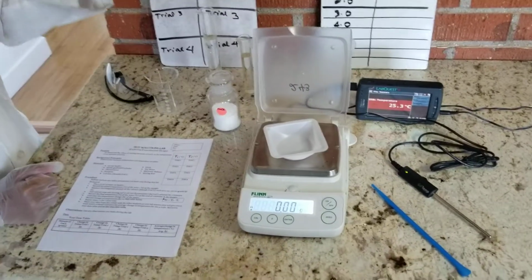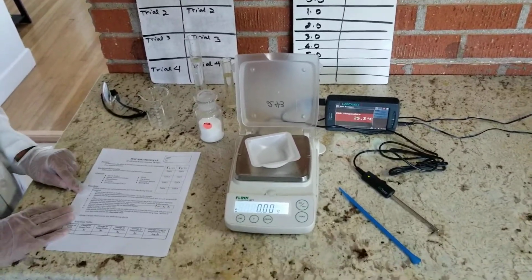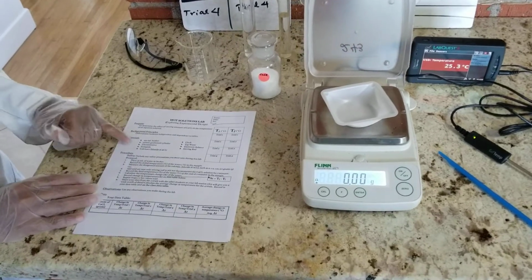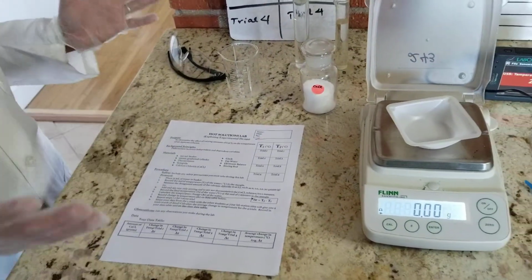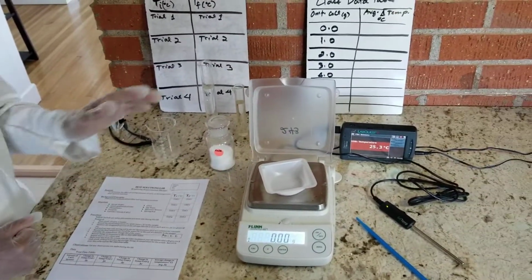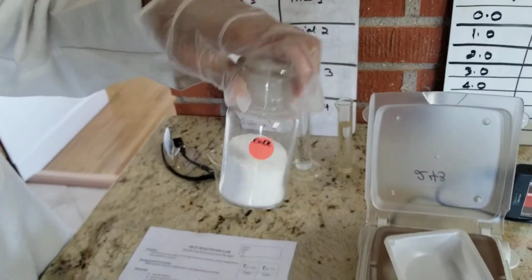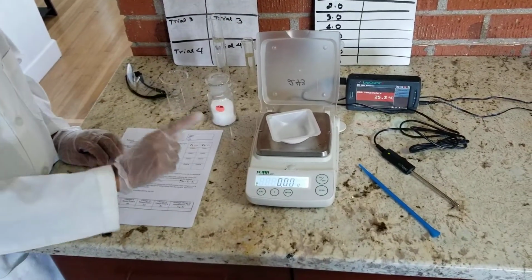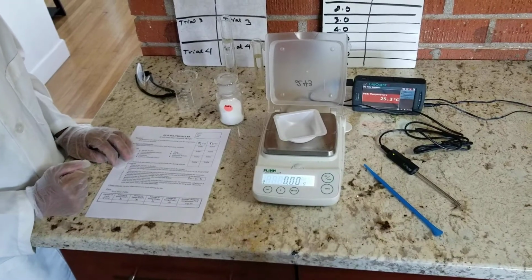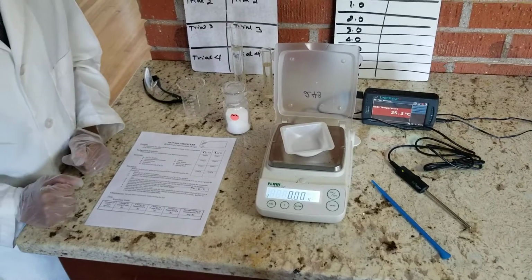So what we have here, we have water, and based on the procedure, it's asking us to use 75 milliliters of water. I have a smaller beaker than what was stated in this procedure. It says 250. We only have, this is about 140, but we don't need a large beaker for this experiment. We also have calcium chloride, so it kind of looks like this powder inside this vial here, and a thermometer, a weigh boat, and our digital scale. Later on, once I have all the data, I'll help fill in the tables that you guys can use.